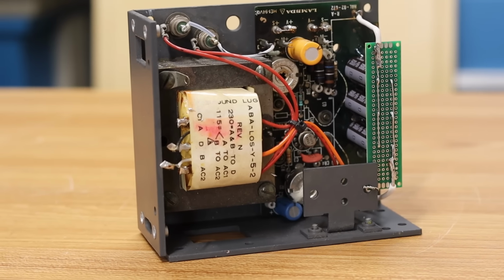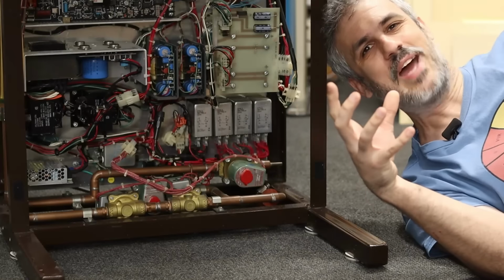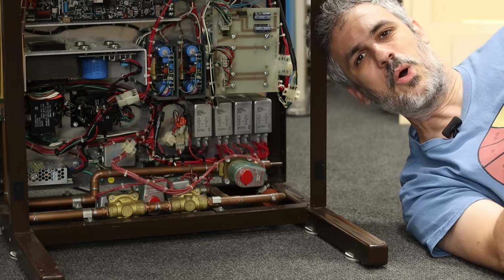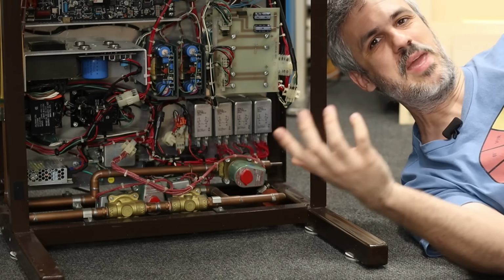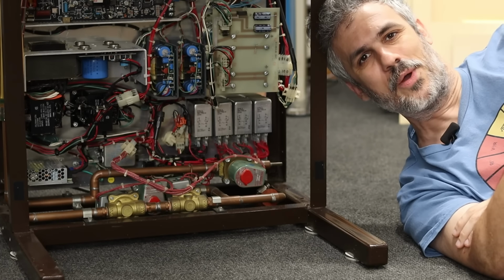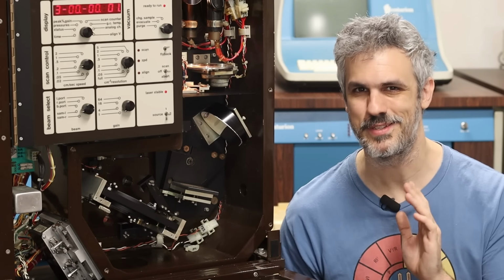And in the future, I would like to get that original linear 5-volt supply repaired. So we're probably going to dive into that and do a dedicated episode on trying to figure out exactly what went wrong with that. But for now, I'm too excited about science, so we're just going to rock the Meanwell and keep an eye on things, and we're going to push forward with trying to get this machine up and going. Which brings us to the next point that you guys were hyper concerned about, and that is the laser.